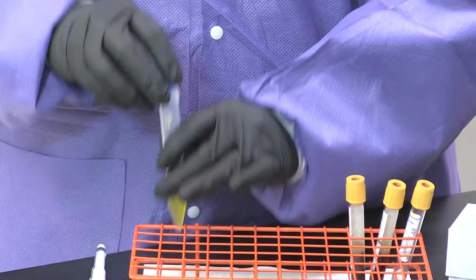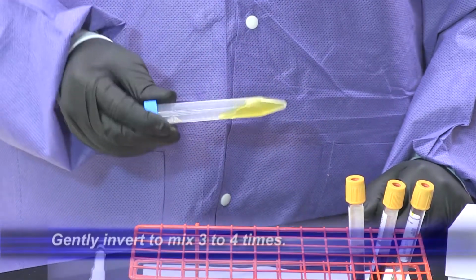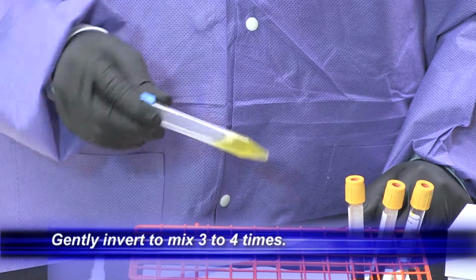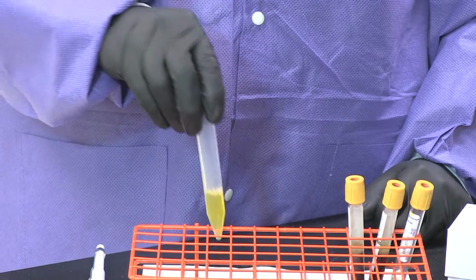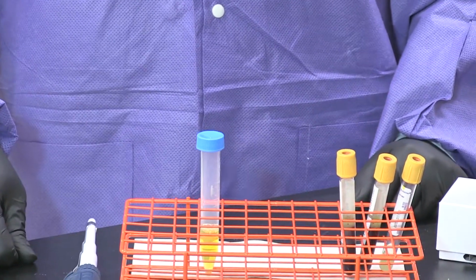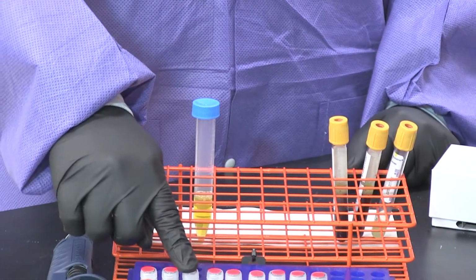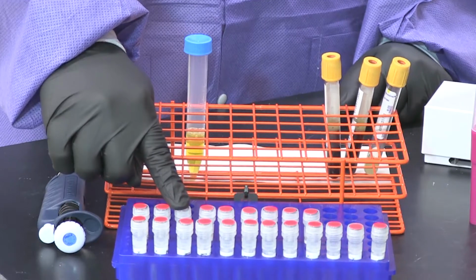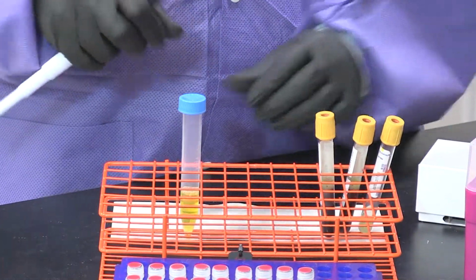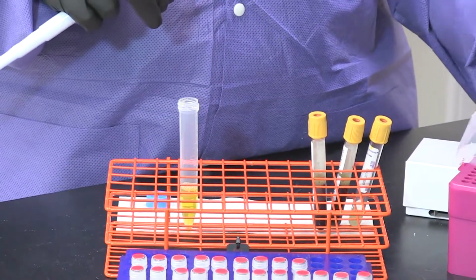Go ahead and securely close that 15 ml conical tube and gently invert to mix 3 to 4 times. Now we're going to transfer from our 15 ml conical tube into our red capped cryo vials. You're going to use the pipette provided by the study set at 0.25 mLs.